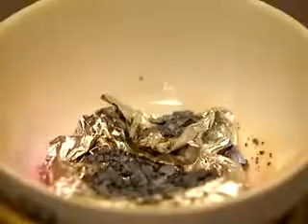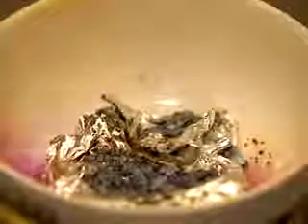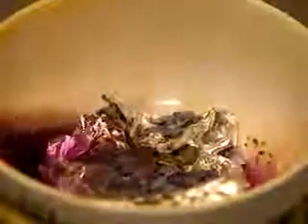The reaction with iodine is just as spectacular. A little warming helps to get things moving, but once the reaction's off, it needs no further assistance.